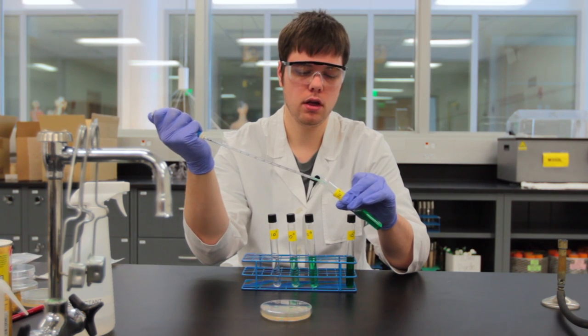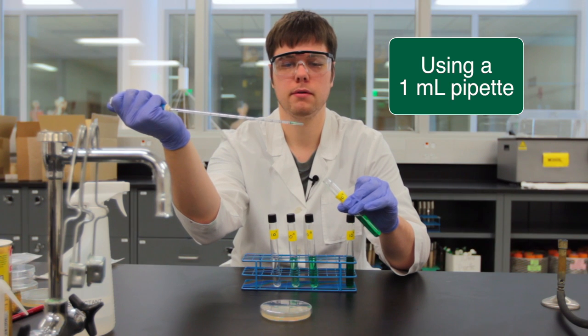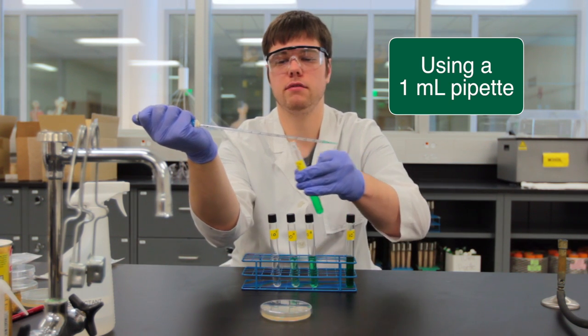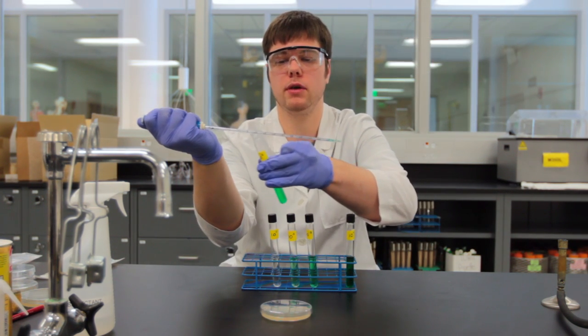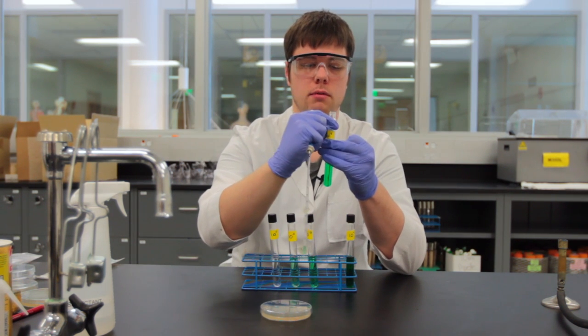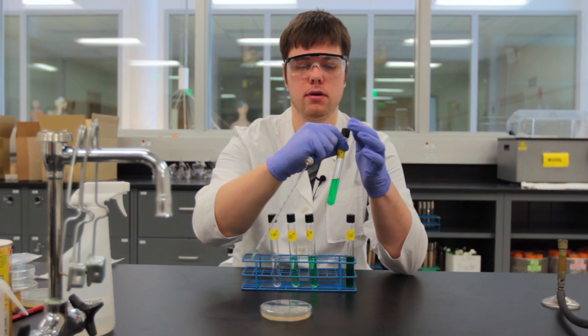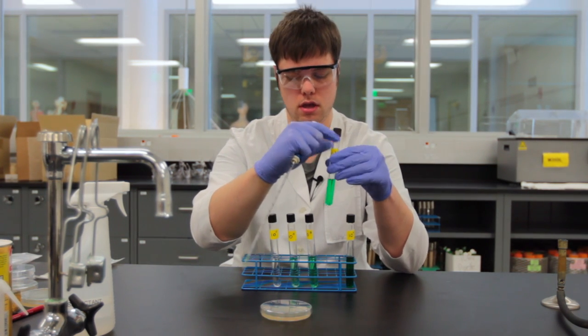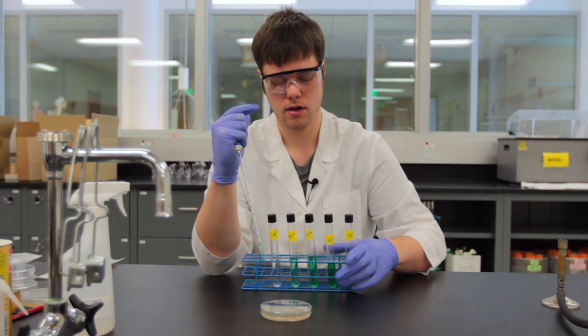Our 0.1 mil is only filling the tip, which is a lot different than filling all the way up to the zero line which would be 1 mil. We're only delivering 0.1 so we fill to the tip. I'm going to very carefully recap my solution and put that into my test tube rack.